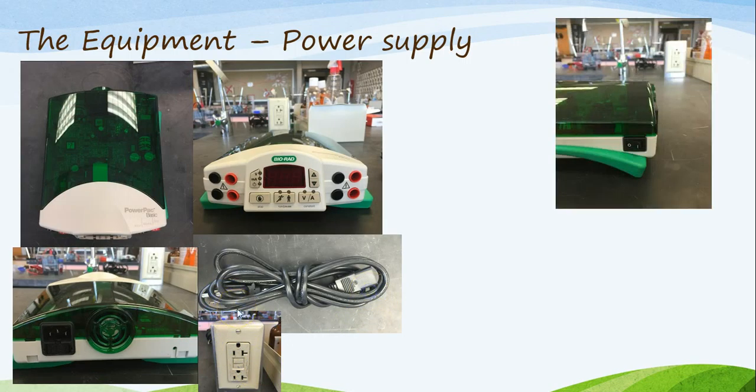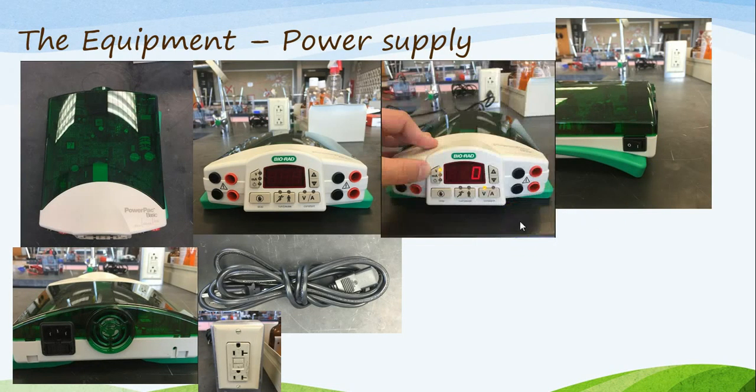From there, once you have the power supply set up with the power cord, you're going to want to press the power button and turn it on. That would be located right here. It is a switch on the back right hand side of the power supply. Once you've switched on that power supply, you will notice it turns on. Once it is turned on, you should see a value of 0 on the screen.